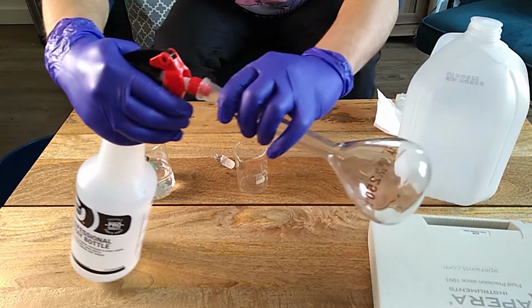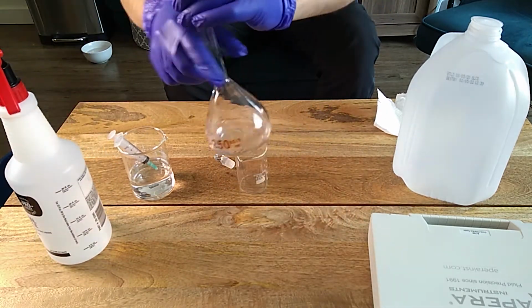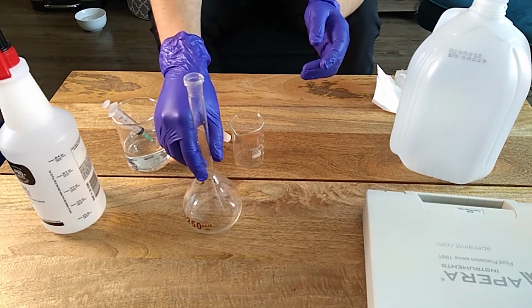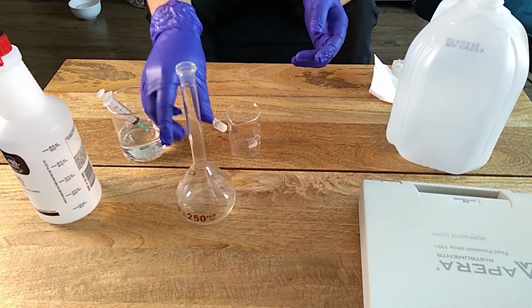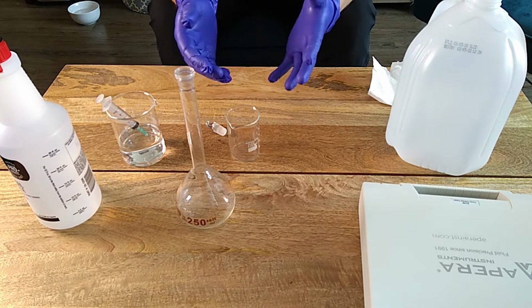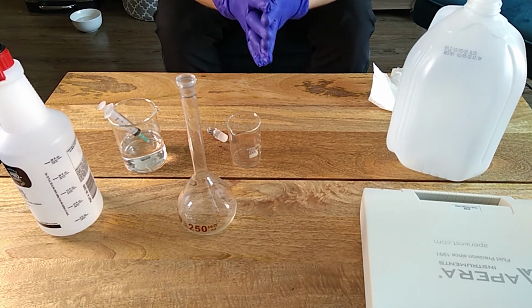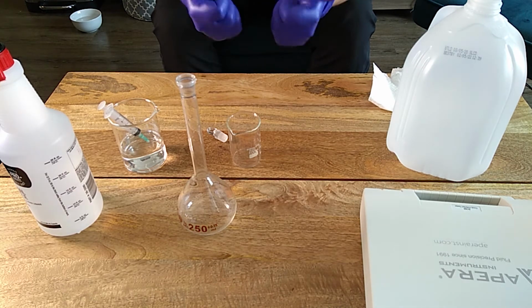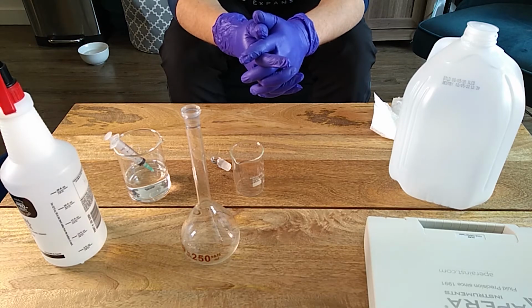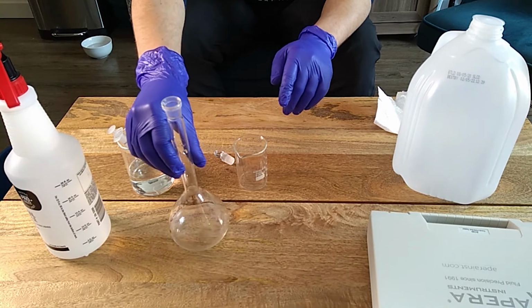I have a bucket there that you cannot see because it's not pretty. Also, whenever you prepare or handle concentrated solutions that are nitrates or anything that's not very safe, make sure you use gloves. I like nitrile; most chemists like nitrile better. These are the ones that I always use and I recommend. So use gloves. Now, how do we measure the volume?